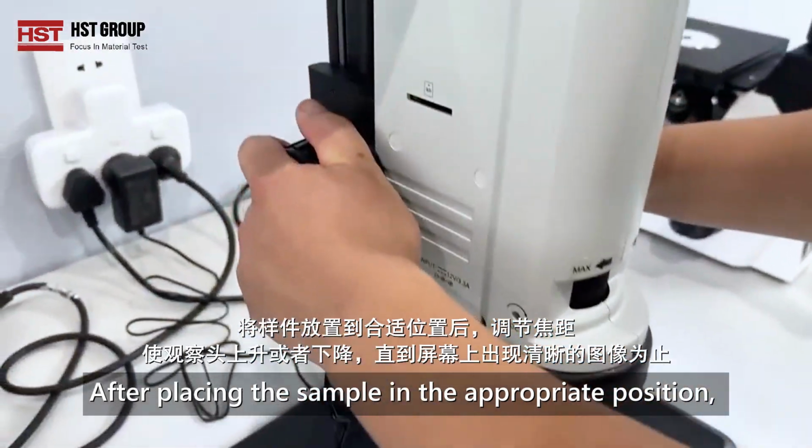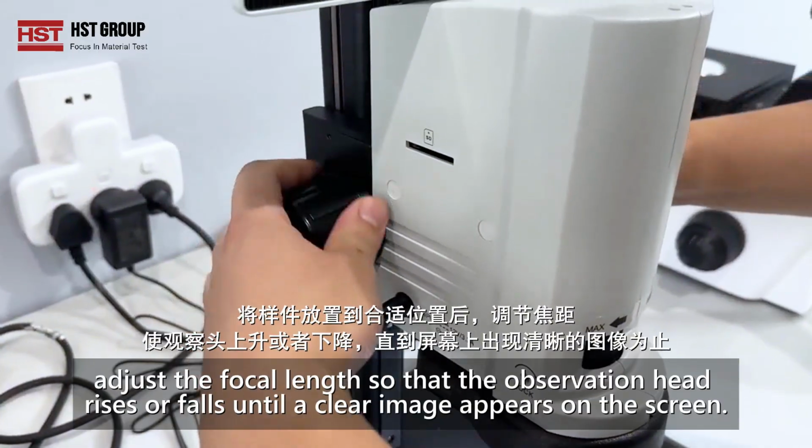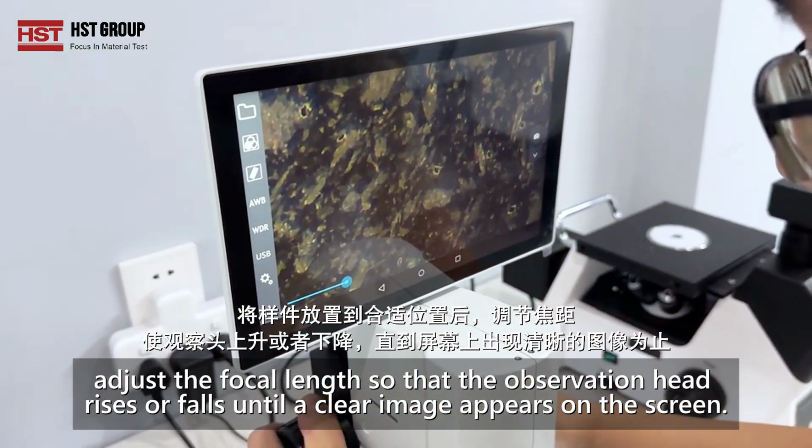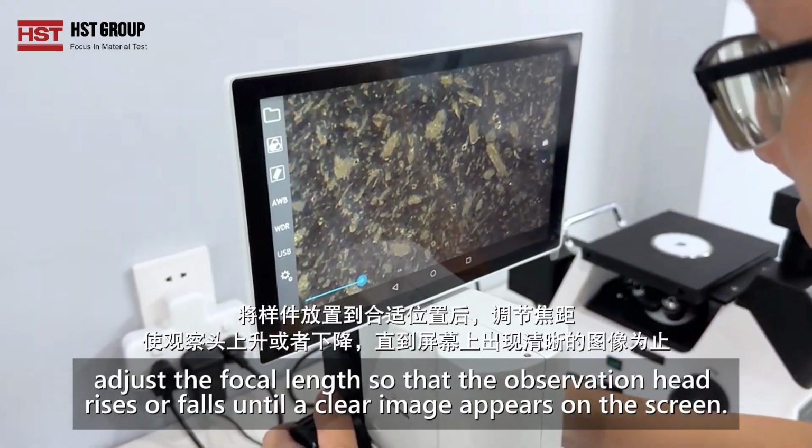After placing the sample in the appropriate position, adjust the focal length so that the observation head rises or falls until a clear image appears on the screen.